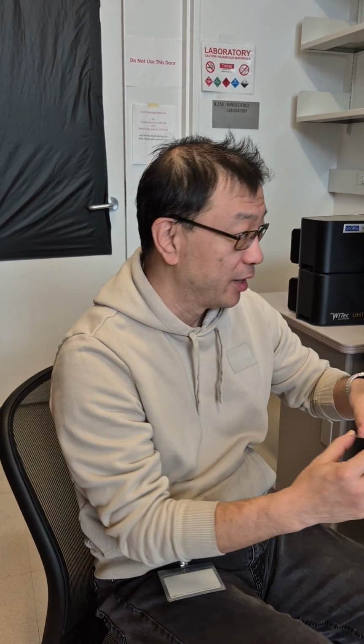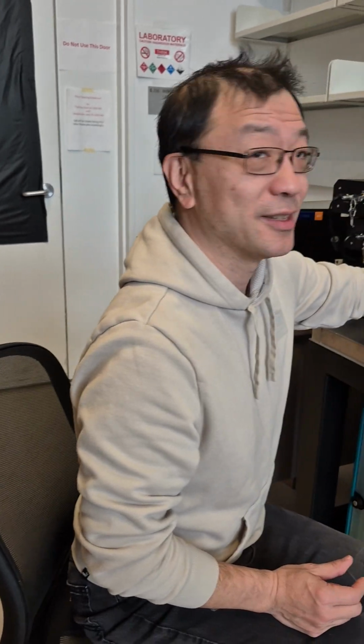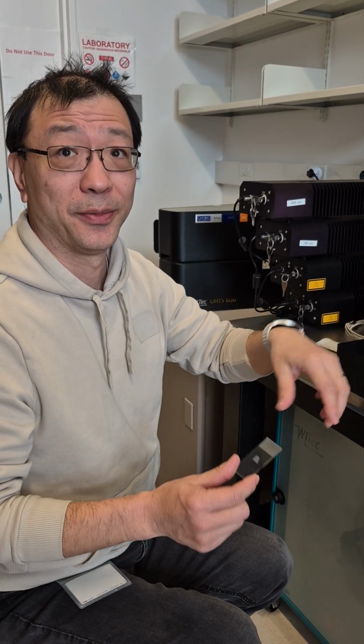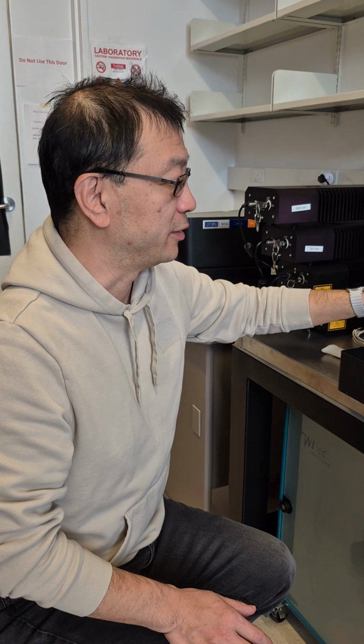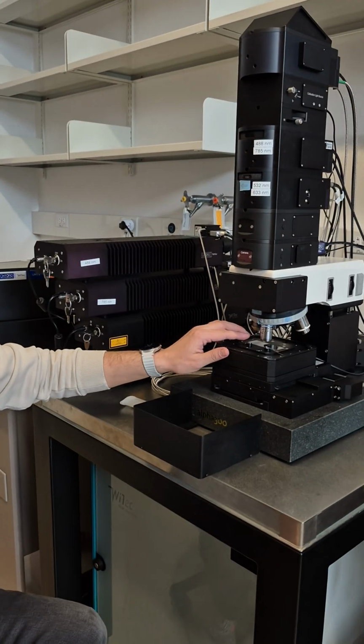But if you have a silicon wafer-like sample, with a very flat surface, you mount it to the glass slide flat. The reason is that it depends on your sample size, because this size of sample is comparable to that center hole. If you put this sample there, it might fall into the hole. So this is just to support your sample on the stage, so it won't fall into the hole.